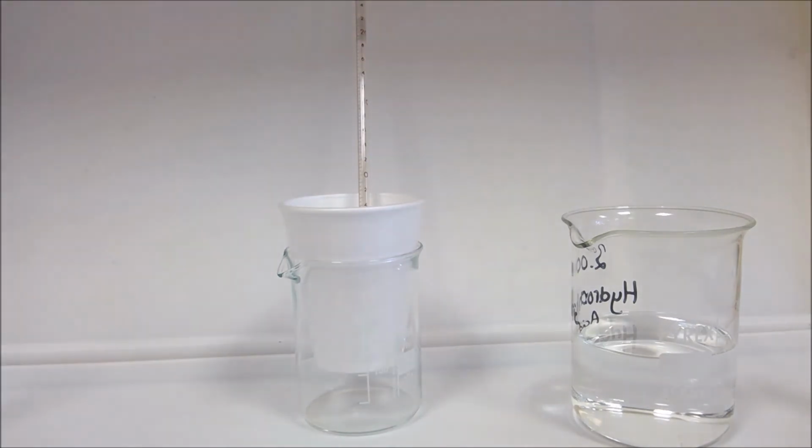Okay, in terms of the method itself, the next step then would be to rinse and dry our apparatus here, and then to repeat the experiment, changing for a different acid. So I've done that already for you. So in a second on the video, there will be a photograph of a set of results. So you need to record your results in your results table, and then work through on the practical sheet the results section, and then have a look at the questions too.